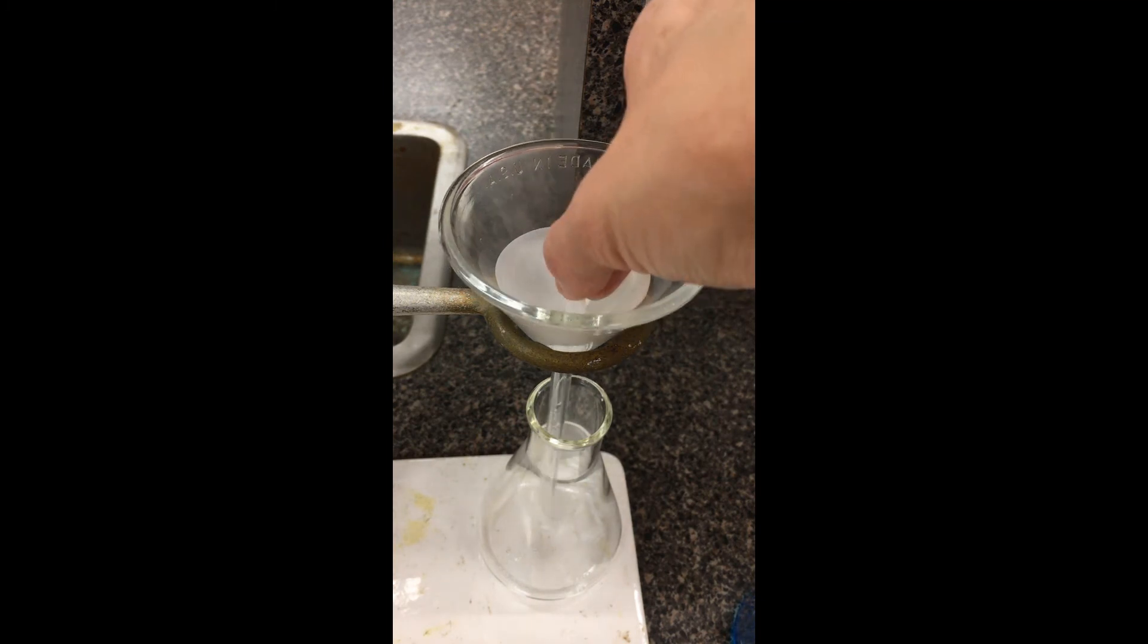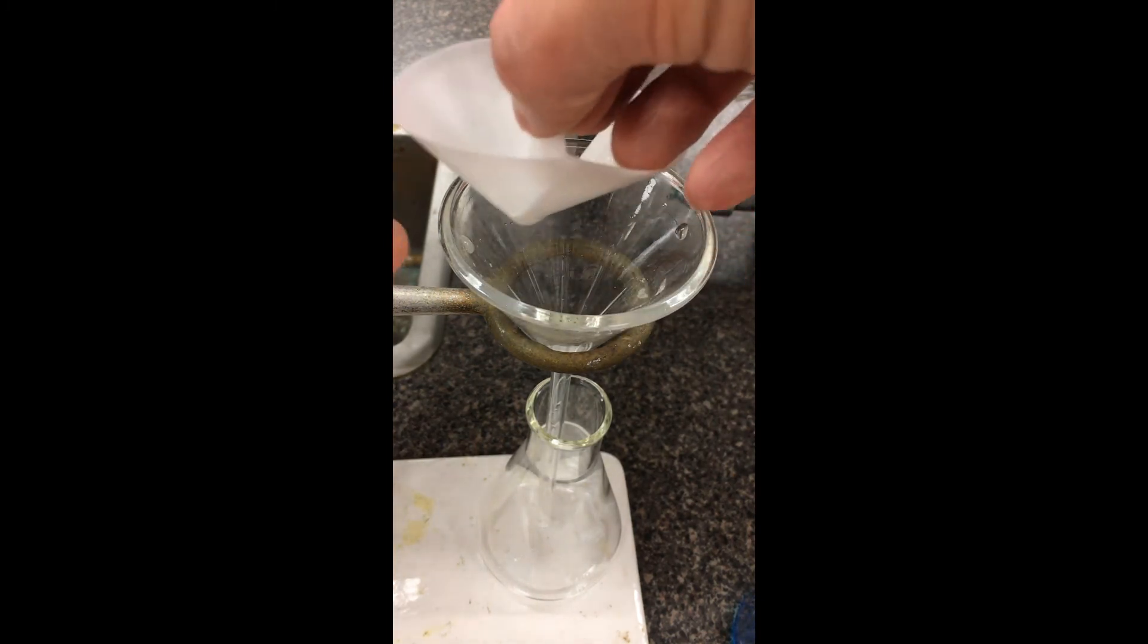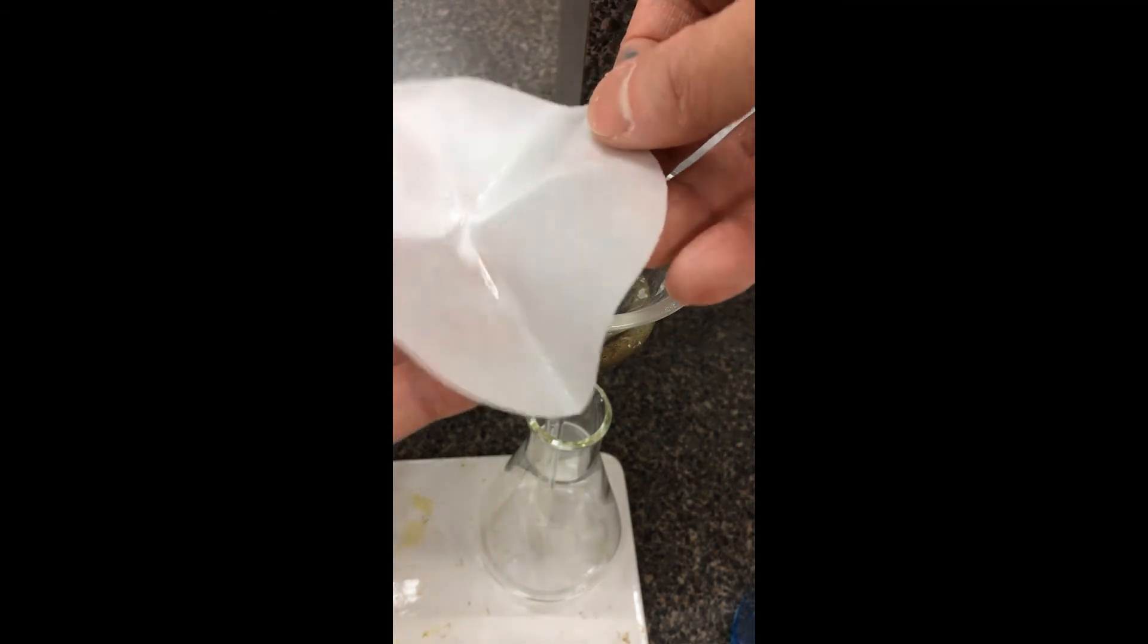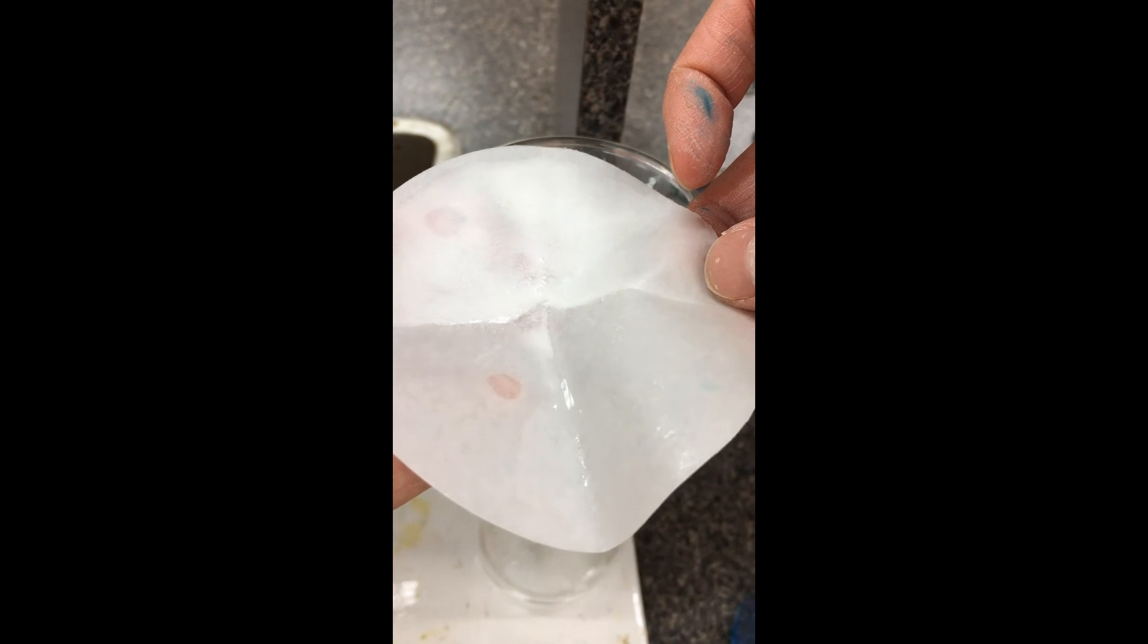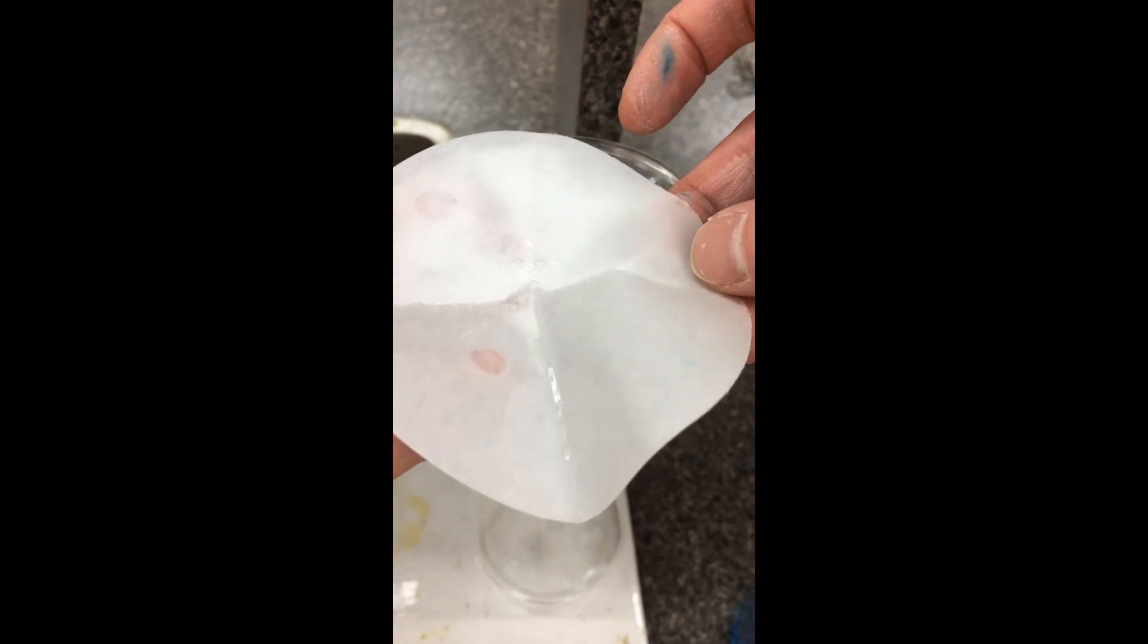Eventually you can just take this filter paper here, just lift it upwards. I would imagine again, once all the water is evaporated here, we would have a lot of residue just left over. By subtracting the mass of the empty filter paper, we can figure out how much residue is left.